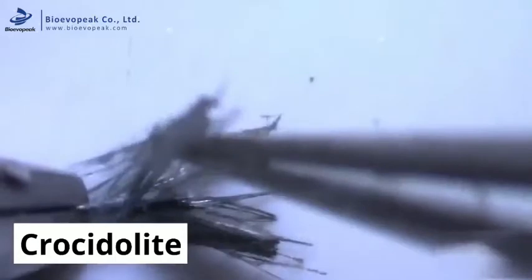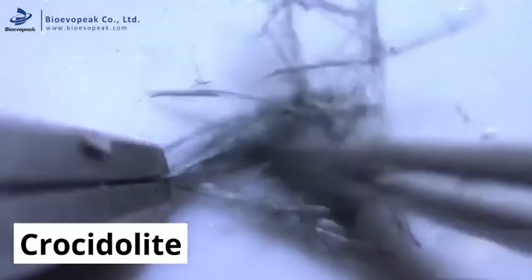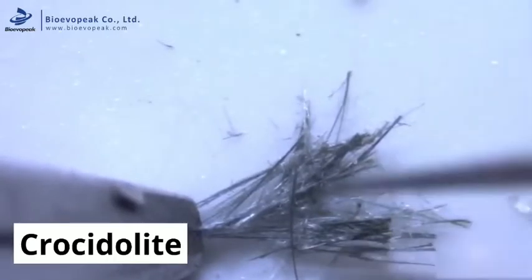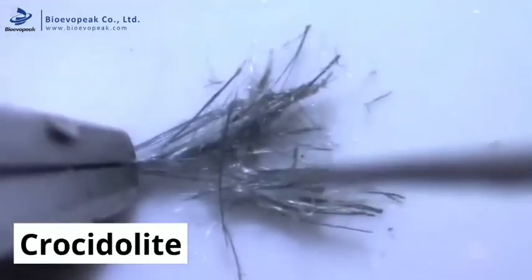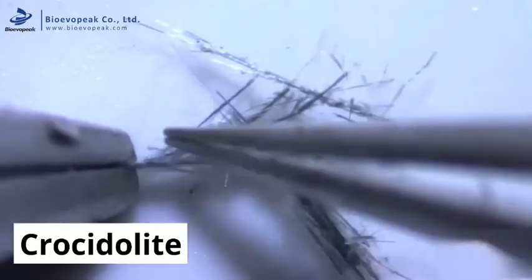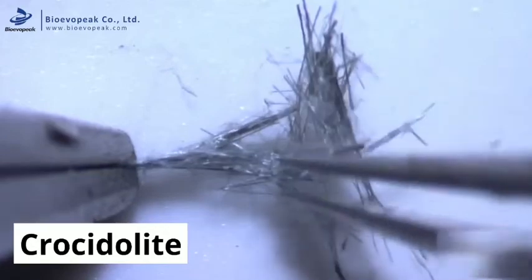These are colour, appearance, lustre, flexibility, tensile strength, tenacity, and elasticity. You can see fibres that break easily when manipulated, becoming short and needle-like.